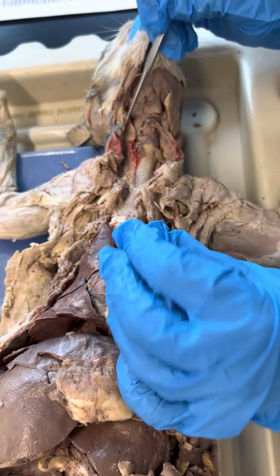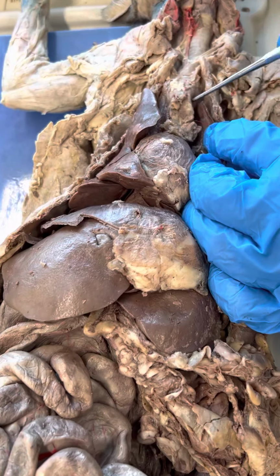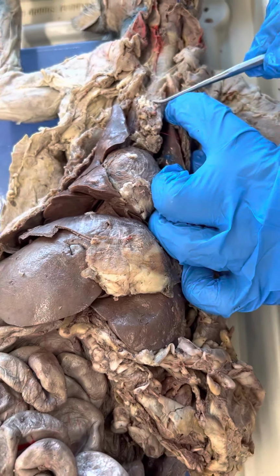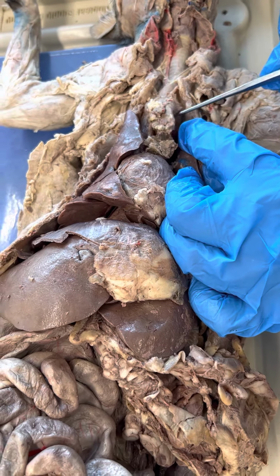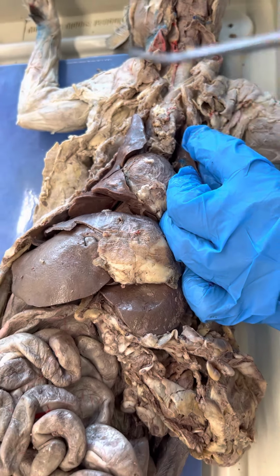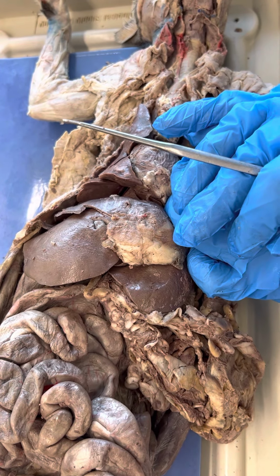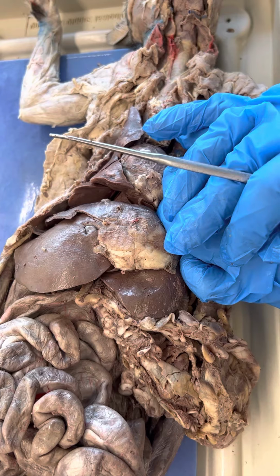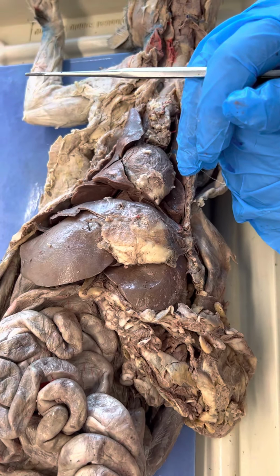Okay, thymus gland is going to be right, it's going to be this mushy stuff in here. It should come up the neck and come down to the heart, depending on the age of the cat. But that would be thymus. Do they give them enough lead in? Like, would they say gland or would they just say structure? I think sometimes they do that. Yeah, if they tell you, that helps.